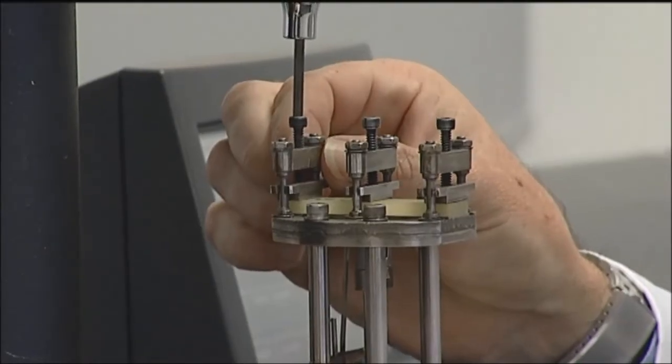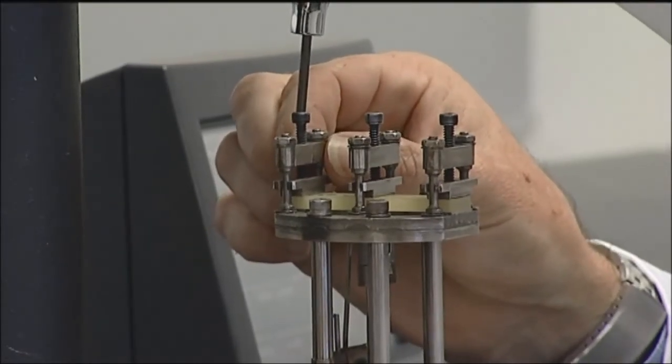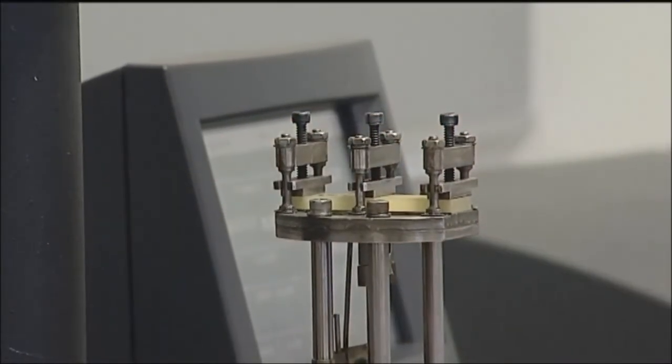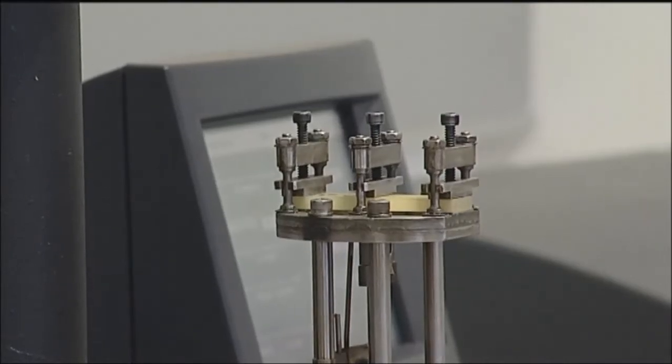You tighten it up until you hear the click, which indicates the right pressure on the sample inside the dual cantilever.